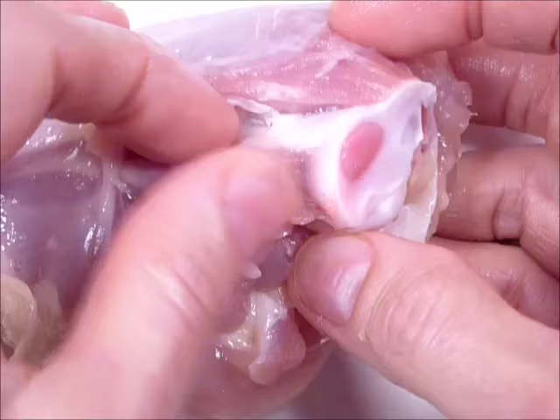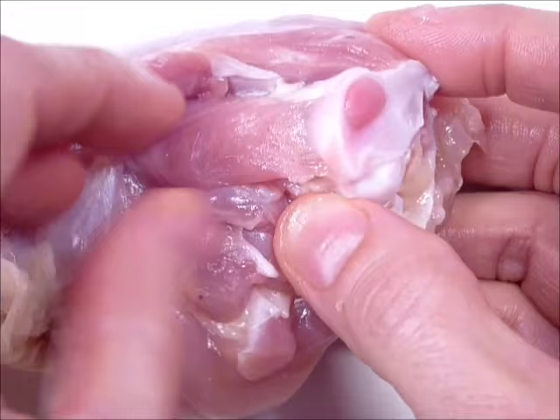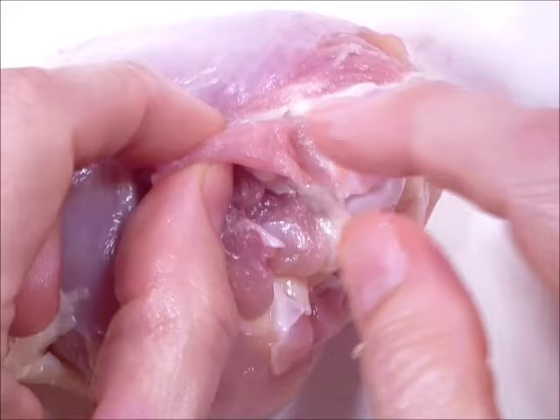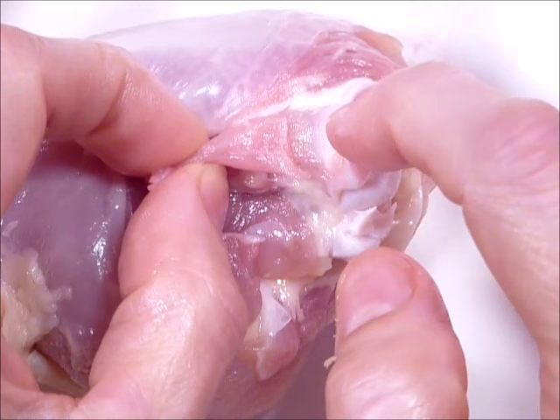Here's a muscle — it still looks kind of shiny from the glare of the lights, but when I'm looking at it live it looks more dull; its fascia has been pulled off. You can actually feel the muscle tissue. At the ends, even though it looks like the muscle is right next to the bone, what's connecting it is the connective tissue, the fascia. They don't call it connective tissue for nothing — muscle fibers themselves don't attach to the bone. It's the fascia that connects muscle to bone.